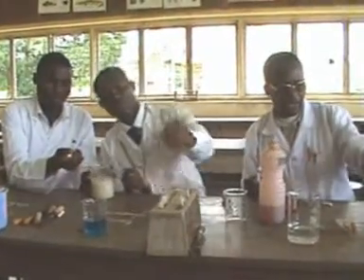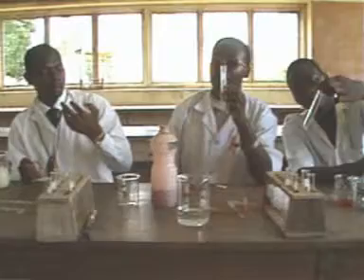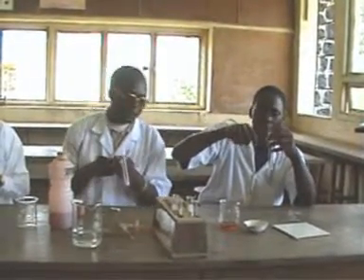Okay. So after having the 1 cm cube, you use a Pyrex test tube. Pyrex test tubes are advantageous because they are resistant to heat. When you heat it even directly, it will not crack. But you can heat it in boiling water or in a water bath. So we now put our solution right into our test tubes, and then we hold it with a test tube holder. When you put it, you then hold it with your test tube holder, so it is not touching your hand.